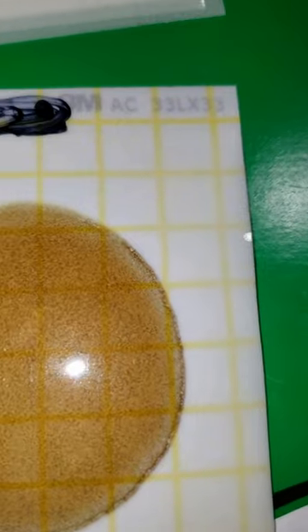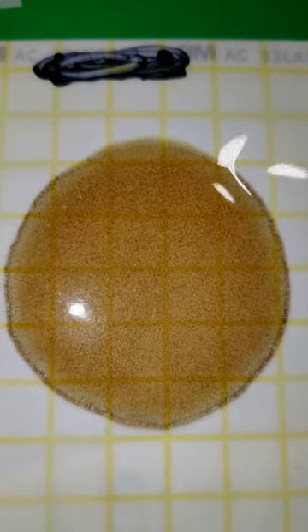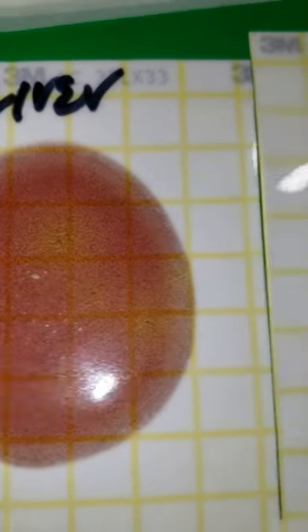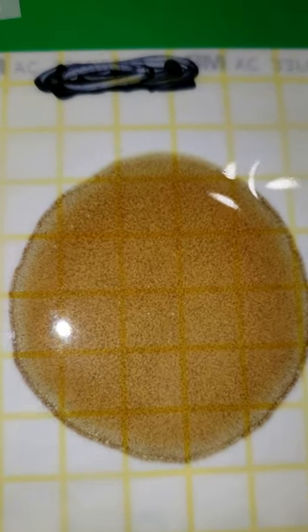I hope that kind of explains things and shows you what I'm looking for in our lab. Just showing you the comparison of this last horse to Oliver: at 24 hours, Oliver's plate is mostly red with a couple of pinpoint areas of yellow; at 24 hours on the abnormal horse, you can see the difference. Mainly what we're looking for on these 3M plates is color change — that's the biggest thing. Lactic acid bacteria will transform based on the volume or population of bacteria. It will ferment and cause a huge shift in color change to yellow, and how much yellow is present tells you the population of lactic acid bacteria. If you have questions or want to look into a culture, check out secondvet.com. Thank you.